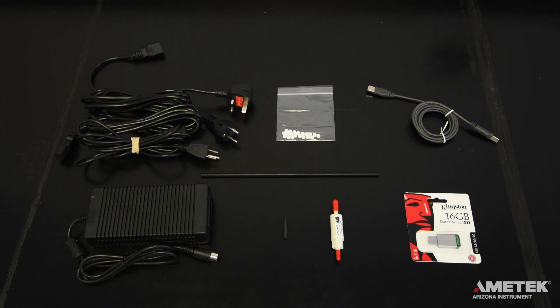Components of the accessory kit for the J405 depend on the instrument model. For all models you will receive a three-foot line cord that meets the requirements of the country in which the instrument will be used, an AC power adapter, one pack of 20 fritware filters, a probe, a quarter inch to one-eighth inch tubing adapter, and a zero air filter.